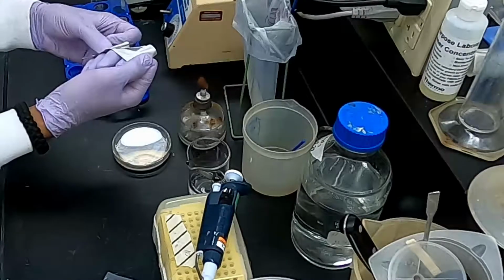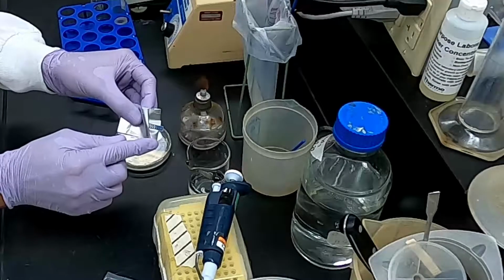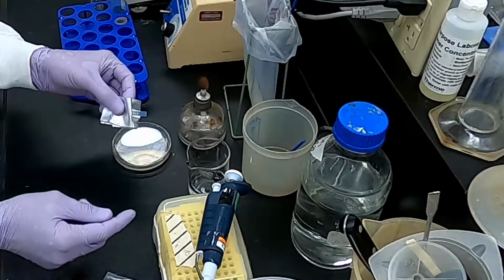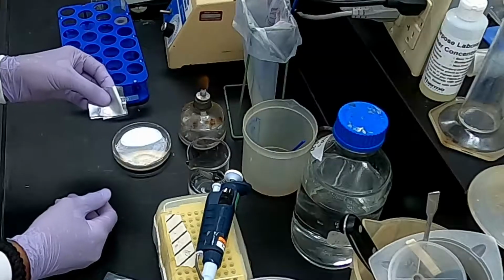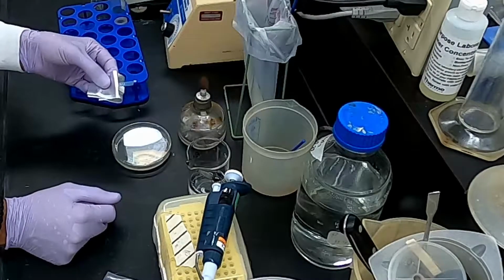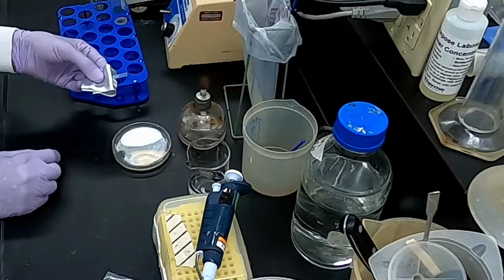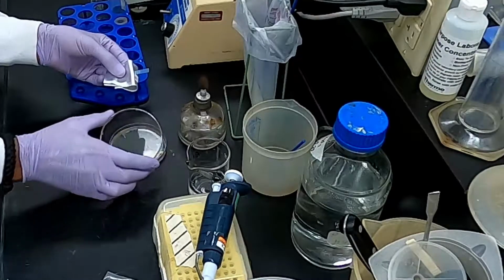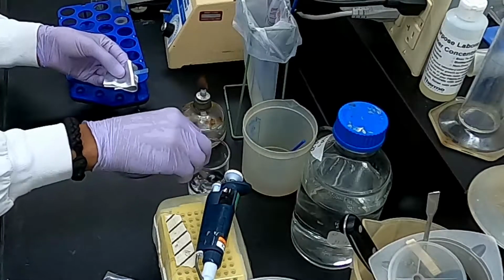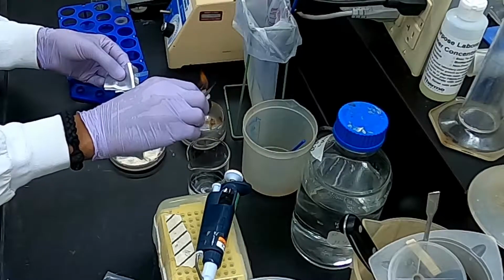And it's very important here because, as you can see, one end of the strip has a logo on it, and that's the end that you want to touch because that part of the strip doesn't have any antibiotic on it, unlike the rest of the strip, which contains antibiotic in a gradient from a high concentration here down to a low concentration at the end of the strip. So we're going to pull out our strip with our sterile tweezers that I've had dipped in ethanol. Just going to flame those off.